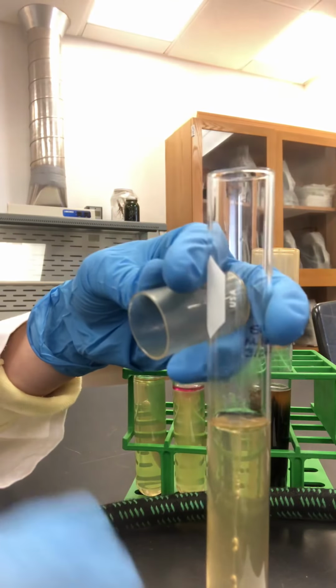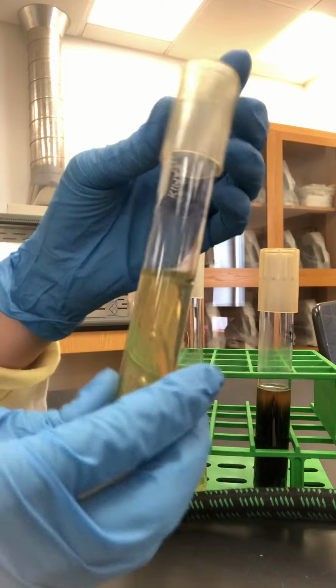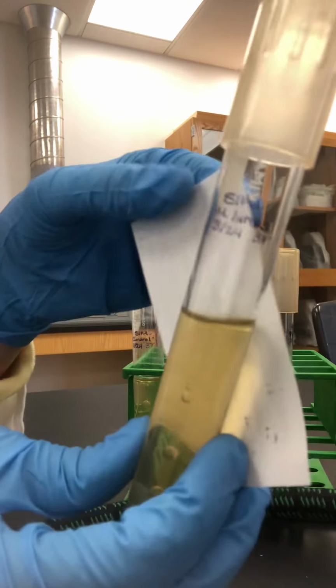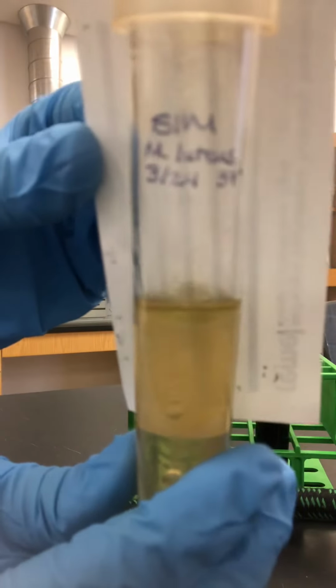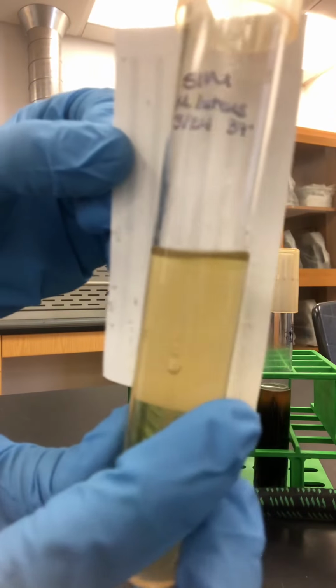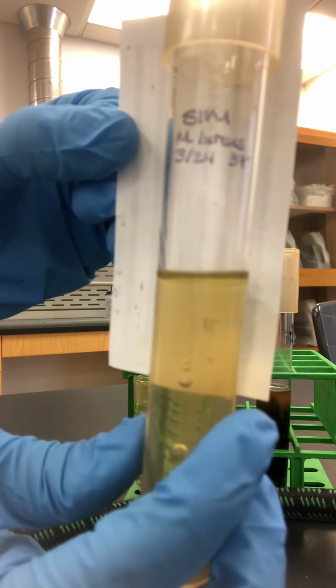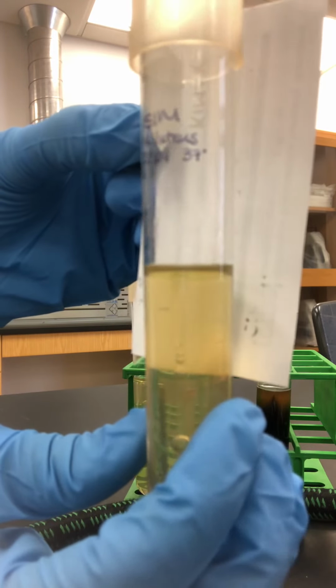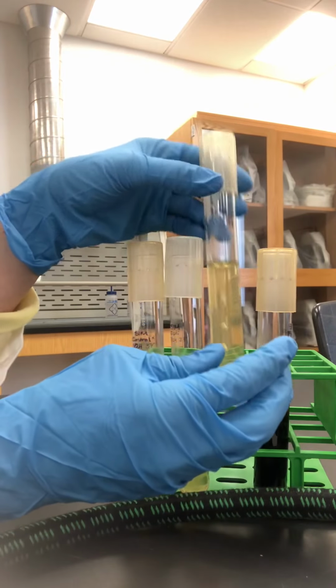Okay, that's enough. So, rope it around in there. So we've got some liquid there on the Micrococcus luteus. And it's not turning pink, right? So that's a yellow result with Kovacs reagent for Micrococcus luteus, which is negative.